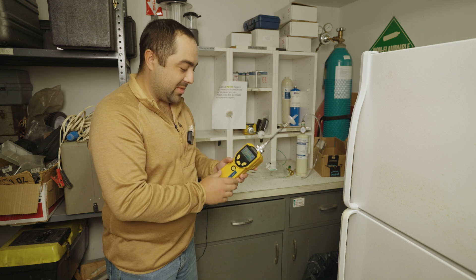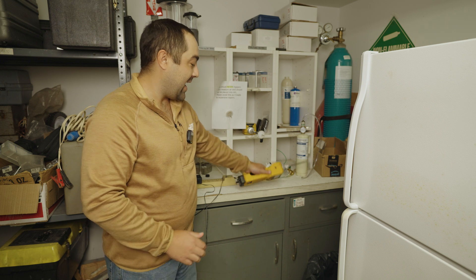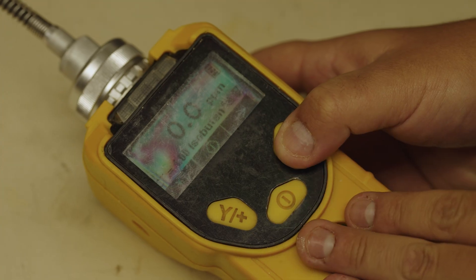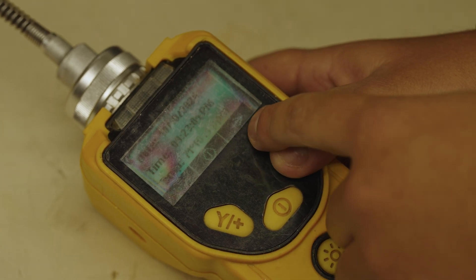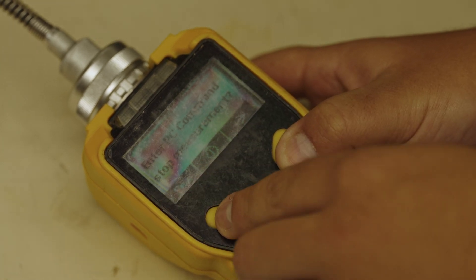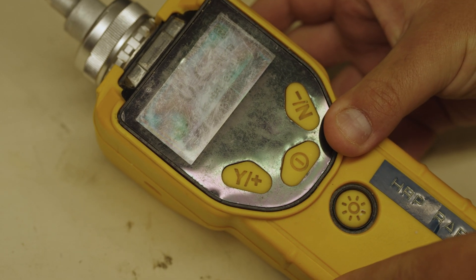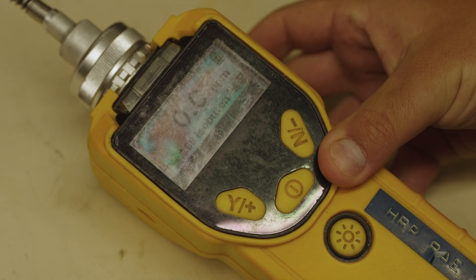For maintenance on the PID, you want to keep it clean. You want to keep this screen out of the sunlight, so when not in use, face it down or face it out of the sun. There's a fan in here that's running constantly as long as the machine is on. When you're not taking readings, it's important to conserve battery life. Scroll over on the menu using the over arrow button until you get to 'enter PC communication and stop measurement,' hit yes, and that's going to turn the fan off inside — you'll hear the fan shut off. Before you go to take your next reading, just hit exit and make sure you're still getting the same baseline reading as before. That'll save your battery life on very hot and very cold days.